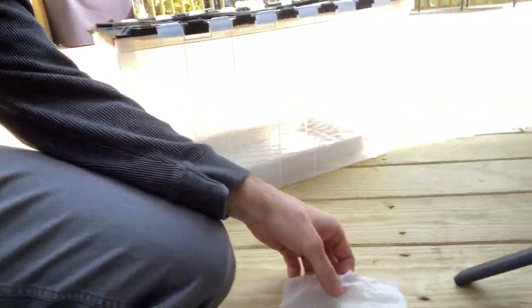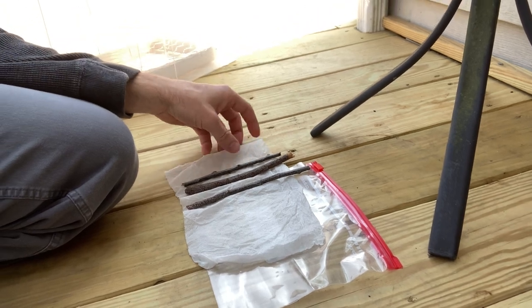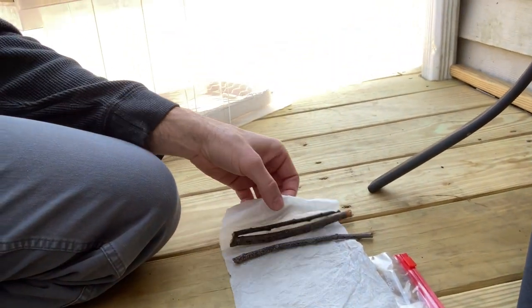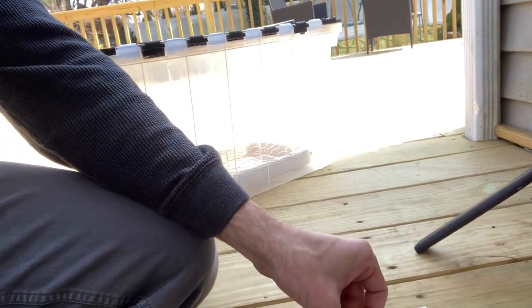So how he does his hardwood cuttings is he first takes them and wraps them in a damp paper towel. You can see them there — these are just for demonstration — but if you had your cuttings you would have them there, and you wrap them up in a damp paper towel. He leaves the ends a little bit exposed.